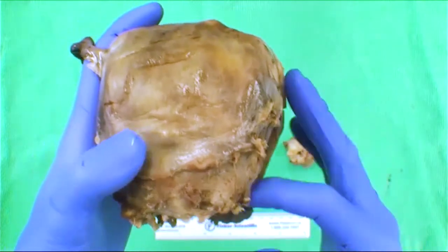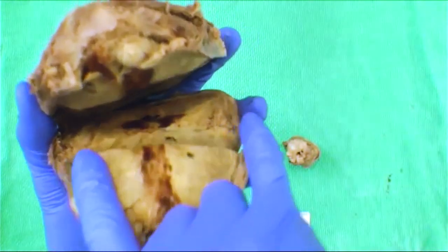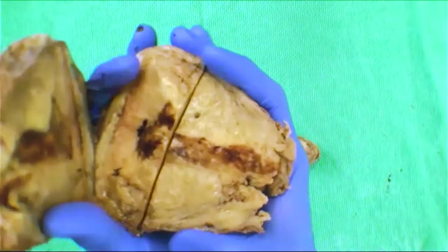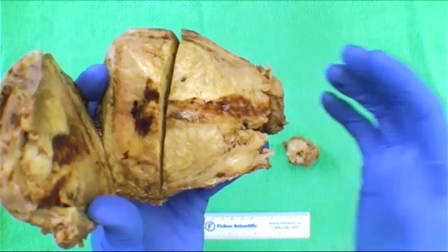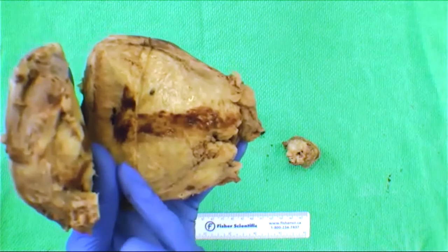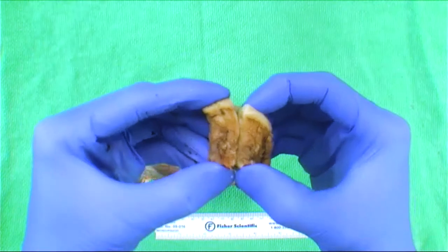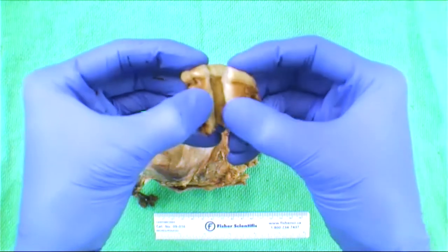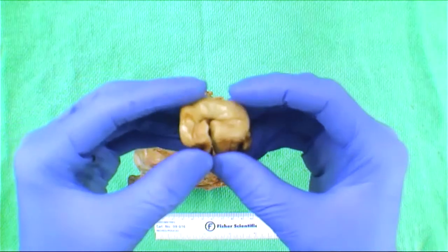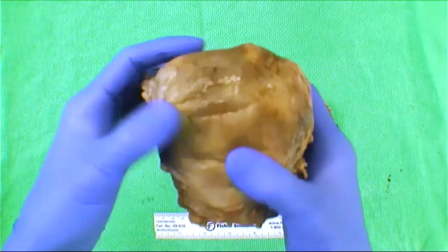The cervix was submitted separately, likely due to technical challenges during extraction. When you're opening the uterus, take a pair of scissors or a knife, understand where the cavity is, and come down both sides laterally to expose your endometrium. You can see how the person opened this — coming down laterally on both sides exposing the endometrium. A similar cut can be done for the cervix. It's best to start with scissors, and once you know your anatomy, complete the cuts with a knife.